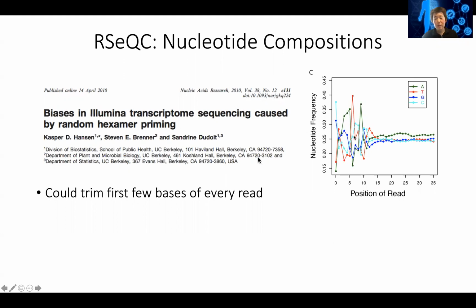So this is a figure to look at, similar to FastQC, to look at across different locations whether you have a fairly even ACGT distribution, and you want to see a flat curve. Depending on the genome, maybe A and T are slightly more abundant than G and C, which is kind of expected for the human genome, but this should be fairly flat across the different bases. If you see these types of position-specific AT biases, that's an indication you might want to trim the beginning of the read.